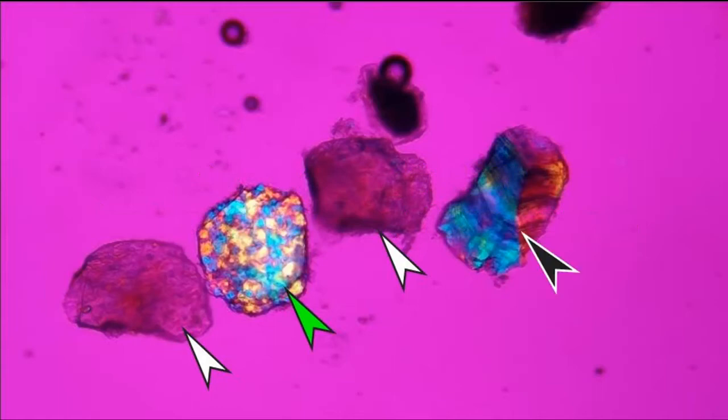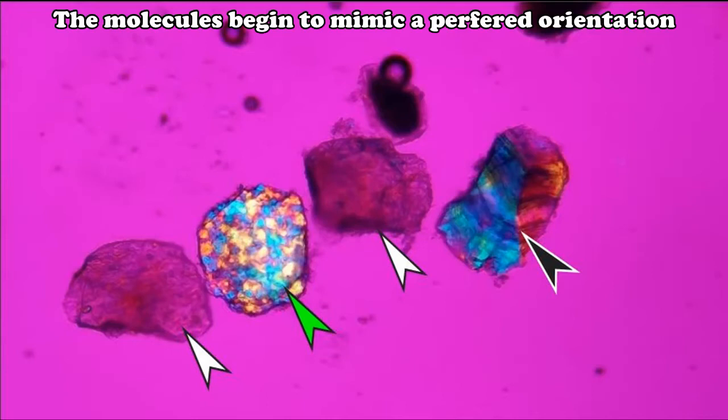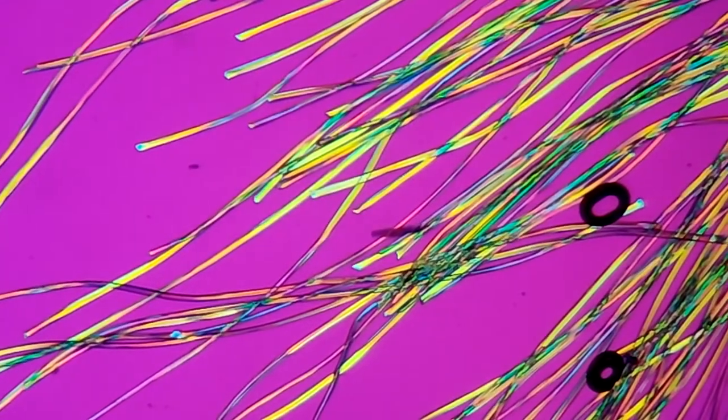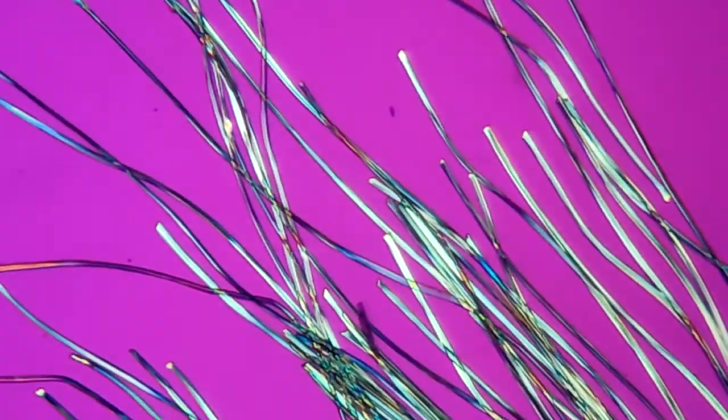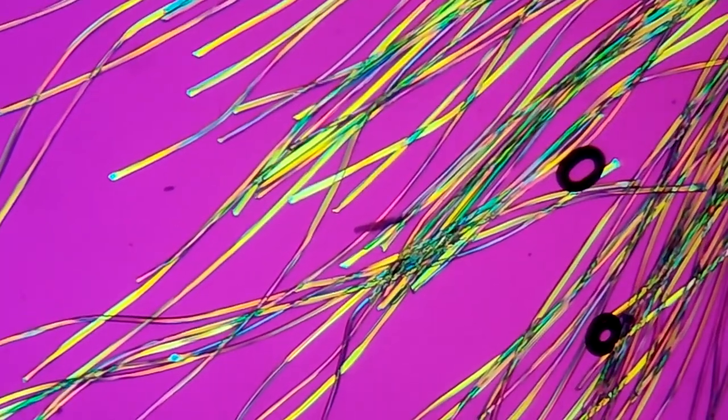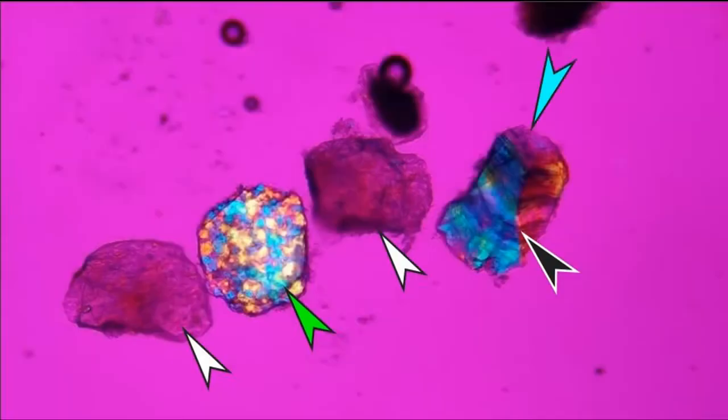Our last little polycarbonate particle has been stretched, and when put under this type of strain, the molecules that make up the plastic also stretch, resulting in a blue and yellow coloration. This is commonly observed on a lot of textile fibers such as nylon, which is extruded and the polymer is also stretched, resulting in a positive sign of elongation. On the top of our little particle, you can still see a section of it that remains amorphous like the other two amorphous particles noted in the image.